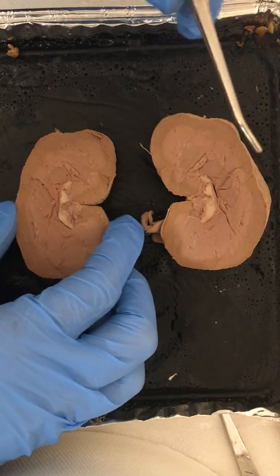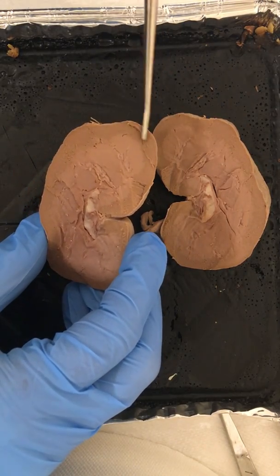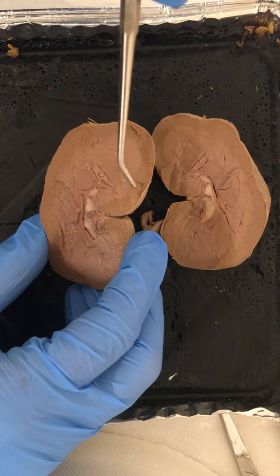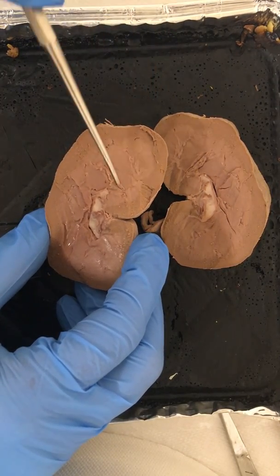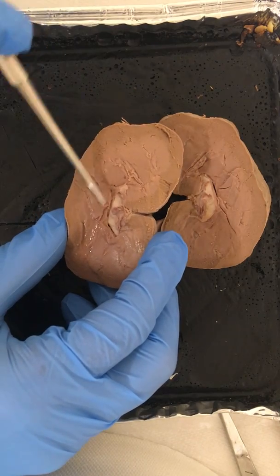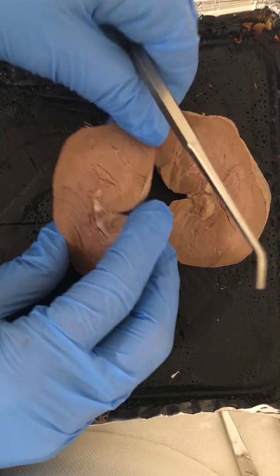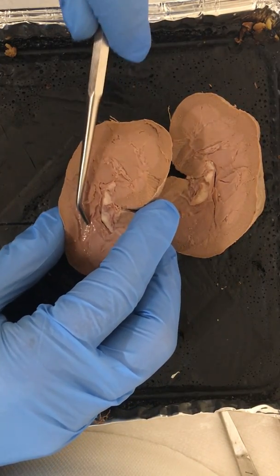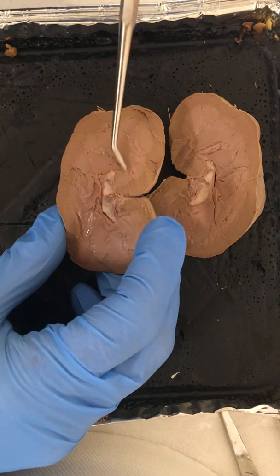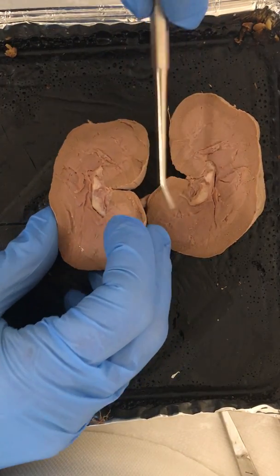That urine production occurs here in the renal lobes, which takes into account a part of that cortex, the medulla, the papilla, and the columns on each side. So those columns are what separates that medulla. And when we have multiple minor calyx, those form the major calyces, which are under here. And when we have a group of major calyces, those form the renal pelvis, which is this middle section here.